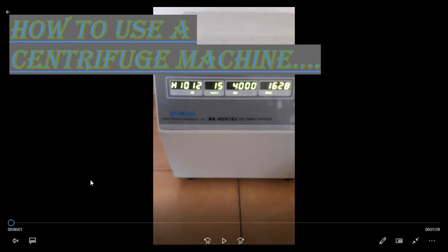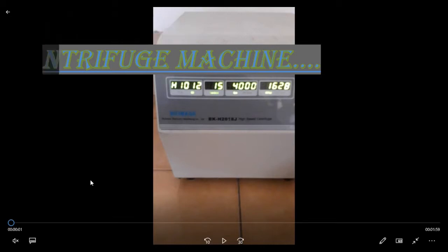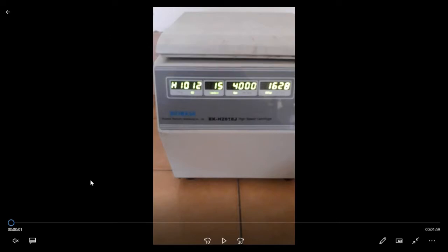Today we will learn how to use a centrifuge machine. Actually, a centrifuge machine is a device which is used to separate materials from liquid samples on the basis of their density. This centrifuge machine has specific positions and inputs where we can place our samples in centrifuge tubes. Then when we turn on this device, the machine rotates according to the settings per minute, and all the samples, with their solutes and solvents, separate from each other on the basis of their density. Centripetal force has a specific role in it.